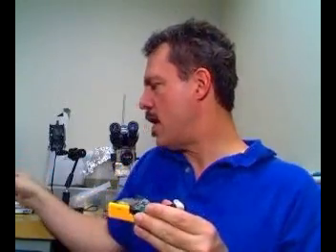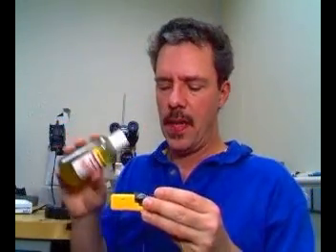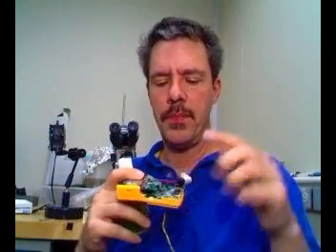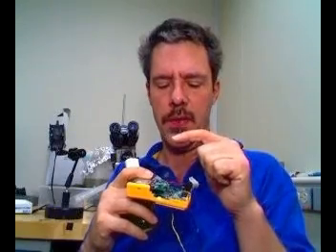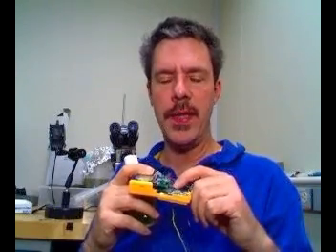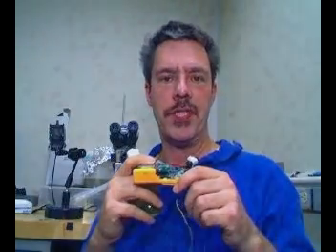We will take our rotifer sample and place a drop of it right on top of the glass protective cover and place a blue LED a few centimeters above it, creating a point source, illuminating the rotifers, creating a shadow on the digital imager chip.